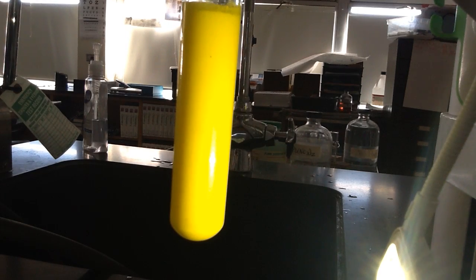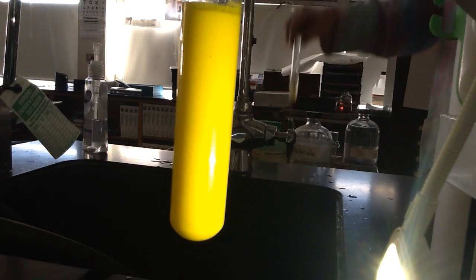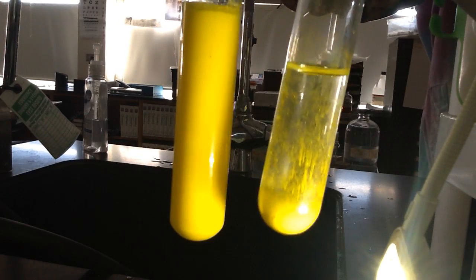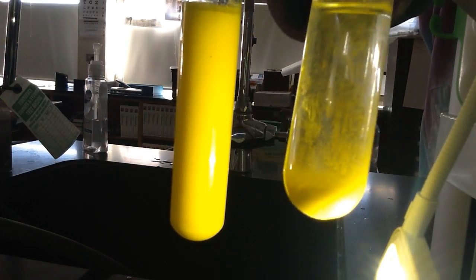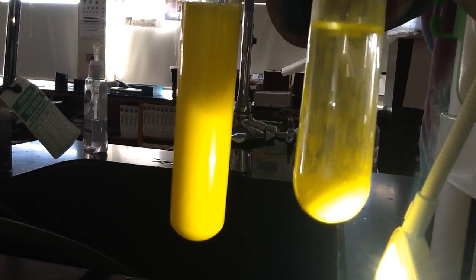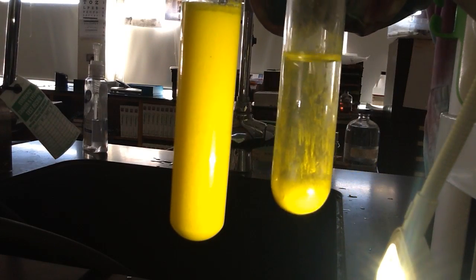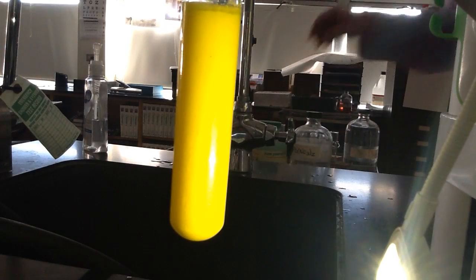Alright, let me show you what that would... Miss Bray did one yesterday, and this is what it's going to look like after you let it sit for a while. In other words, all that yellow coloring is actually a solid powder called a precipitate, and it all, if you let gravity do its work, it will all fall to the bottom.